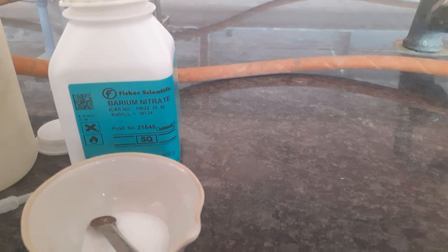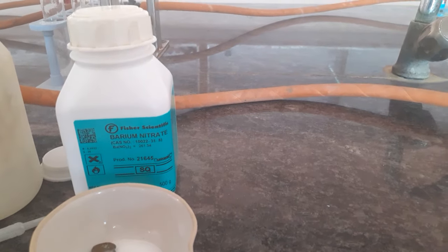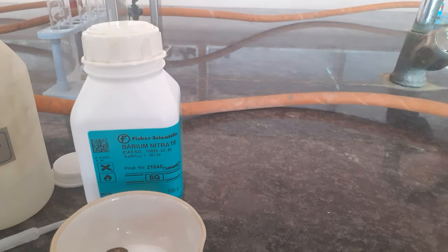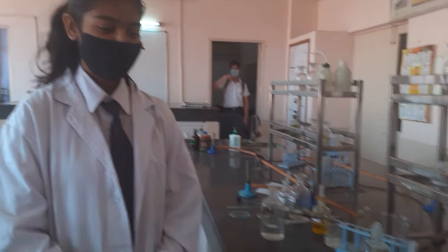Since you won't know it is barium, we will always proceed beginning from group number 0. My student Sreeja will be performing the experiment — she is our expert of the day for cation analysis. Let's begin.